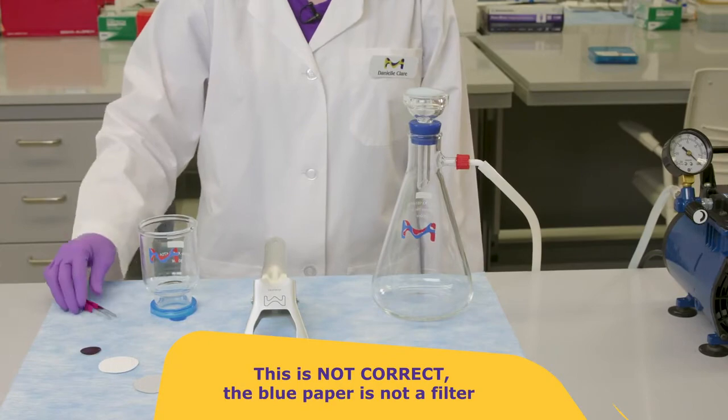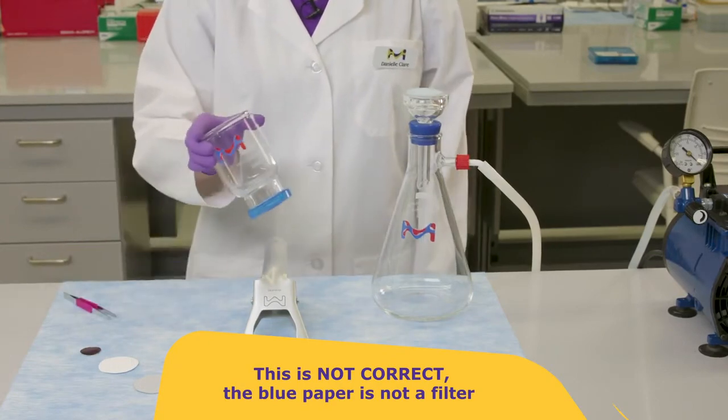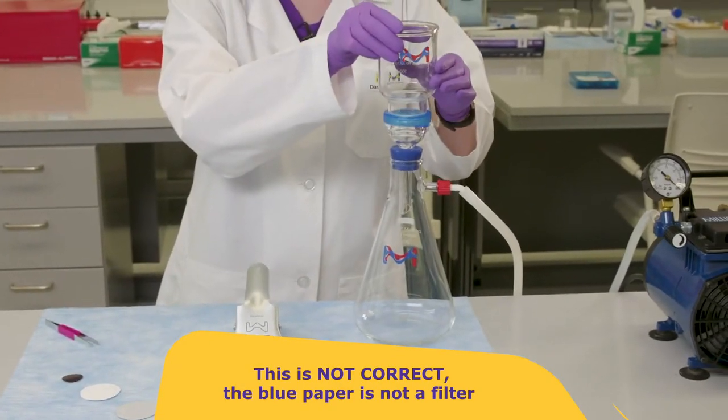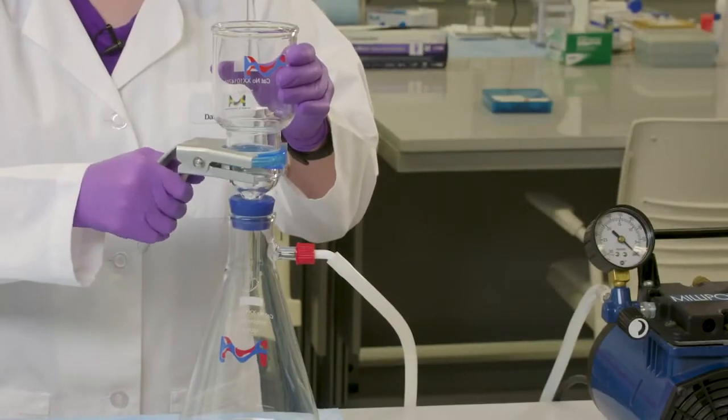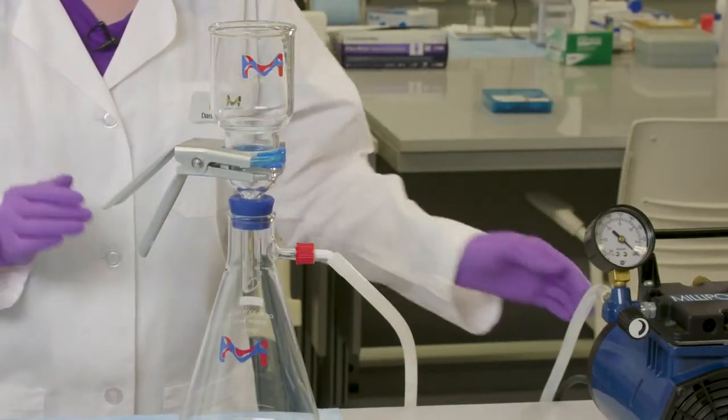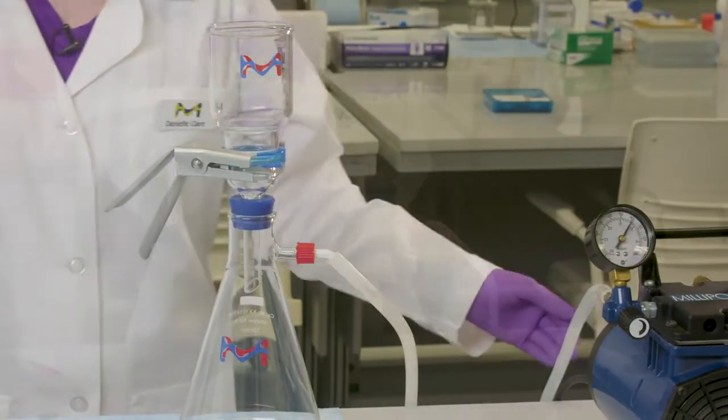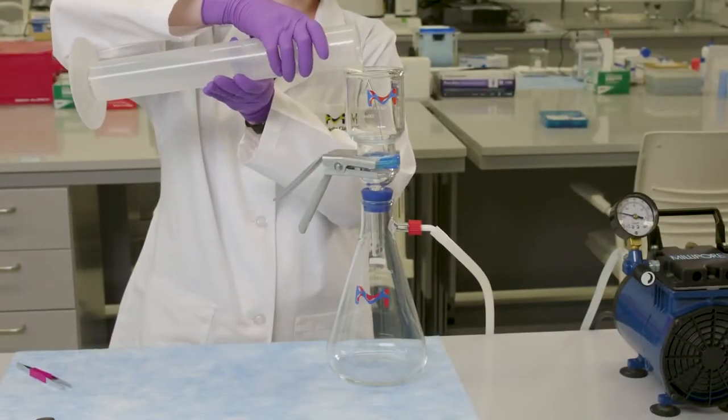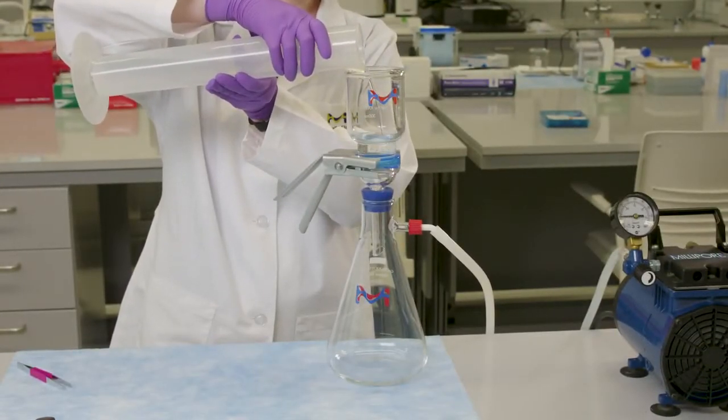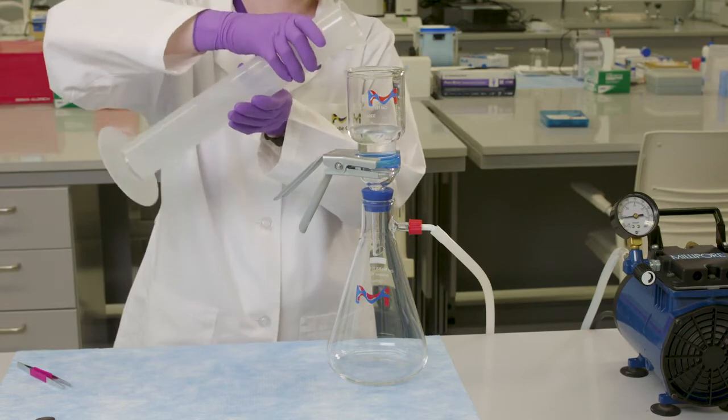Here, I will demonstrate what happens when you use the blue paper in a glass vacuum setup. As you can see, the blue paper does not act as an effective filter.